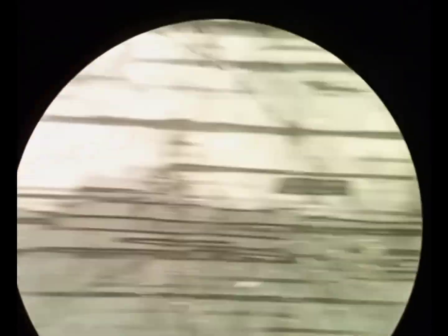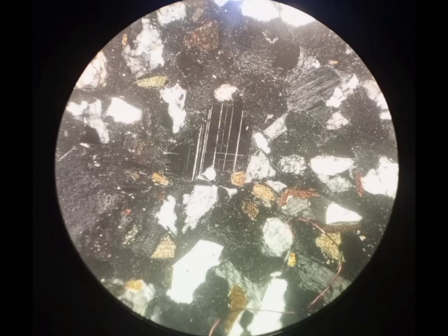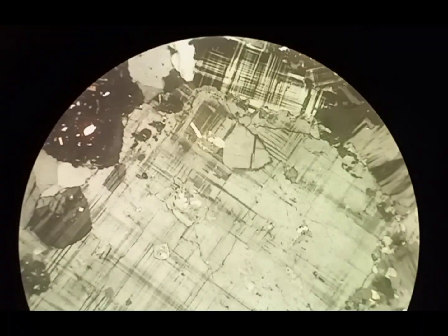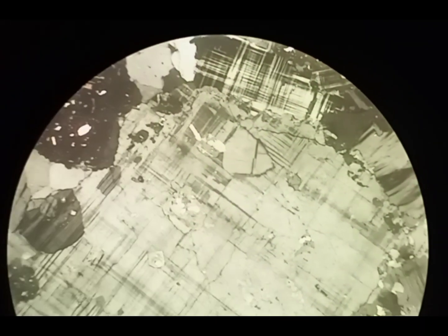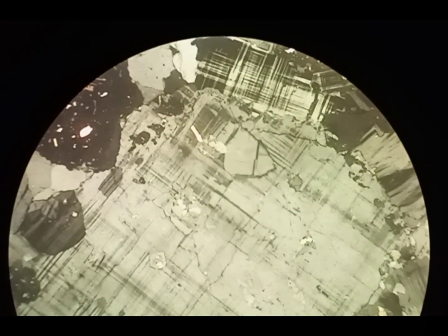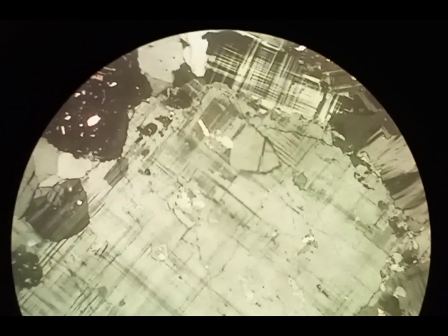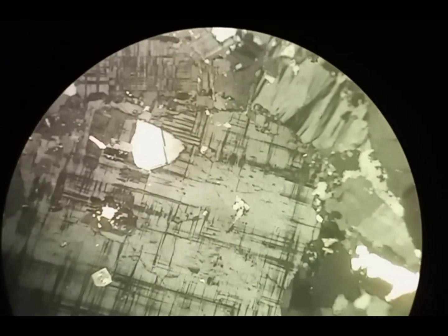Feldspar is a major constituent of igneous, metamorphic, and sedimentary rocks. We are going to discuss how we identify feldspar in thin section. Let us start our conversation from cross-polarized light. In XPL, it shows first-order interference color.